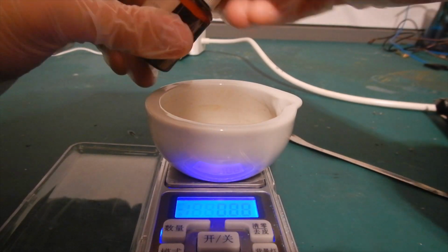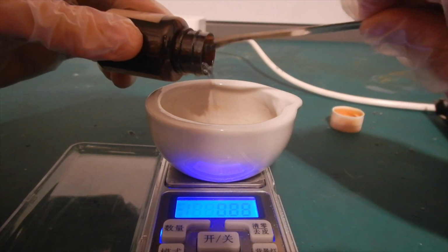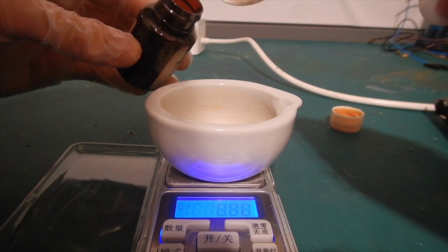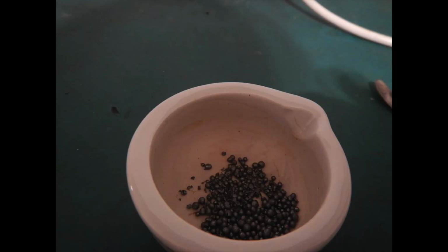We start by weighing 7.62 grams of elemental iodine in a mortar. Iodine is a shiny purple-black solid that readily sublimates at room temperature. For this reason, do this step fast and minimize exposure to iodine. You can see that the mortar was already tanned yellow by the iodine vapor.